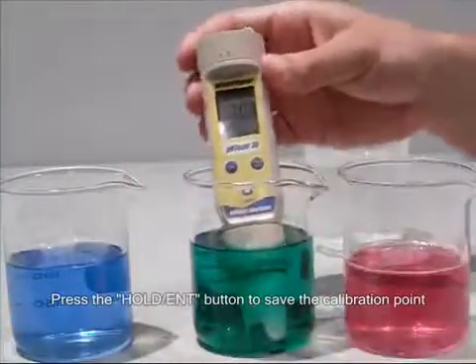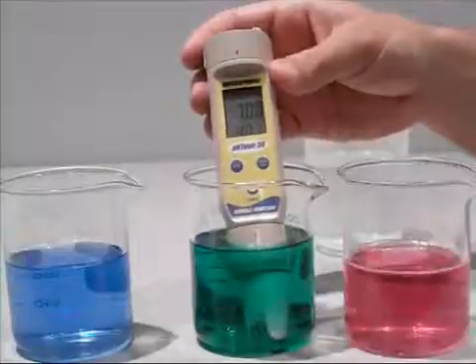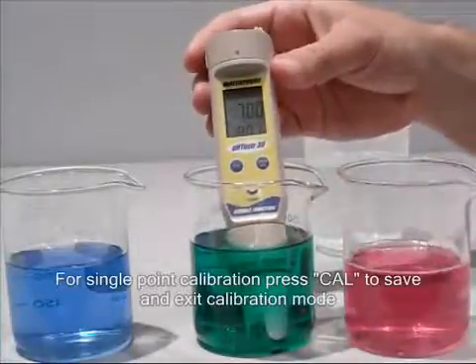If you are doing a single point calibration, press the CAL key at this point to exit calibration mode.